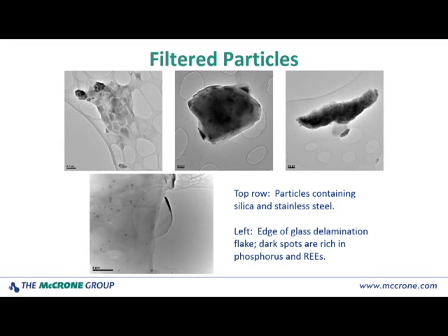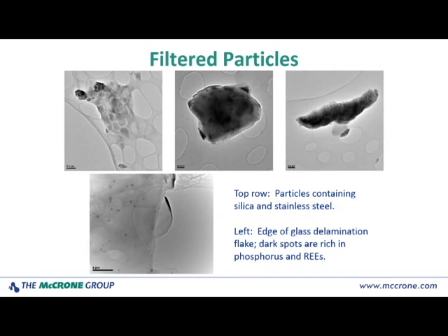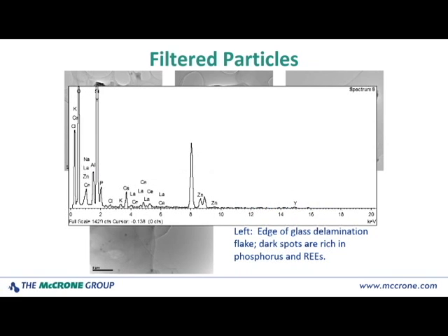The three images at the top show particles that were found throughout the sample that contain both silica and stainless steel. So you have a very large silicon peak in the spectrum, but you also have the iron, chrome, manganese, and nickel characteristic of a steel material. And this was quite common in a lot of these particles. Down at the bottom, we have a higher magnification image of the edge of that big glass delamination flake, and you can see dark contrast features in that flake. And those spots, the elemental analysis showed to be rich in phosphorus and rare earth elements. So a somewhat different glass composition, but easily recognizable in the TEM.